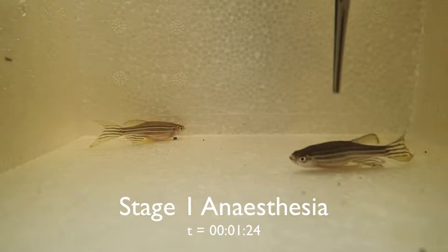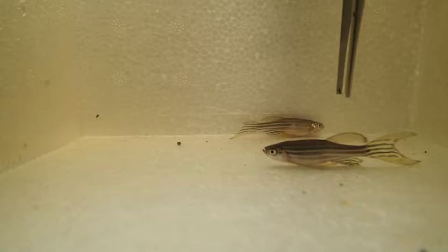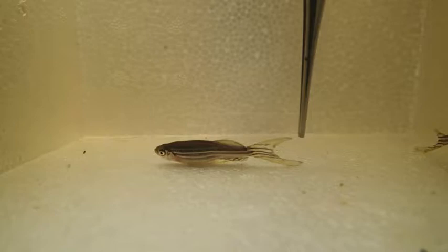Here we've entered stage 1 of anesthesia, and within 10 seconds we've jumped into stage 2. Stage 1 is where they're lightly sedated, with slight loss of reactivity to stimuli and a slight decrease in respiratory rate.